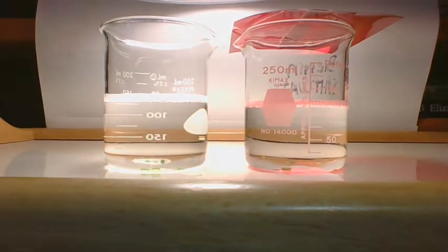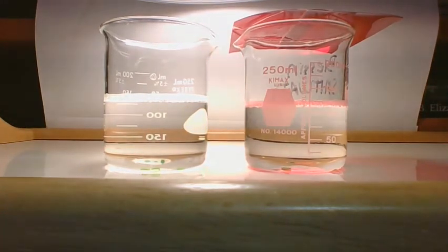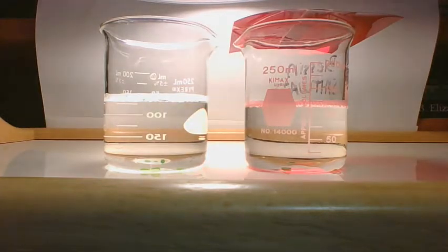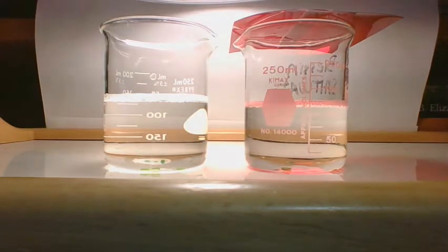Okay, at 2 minutes, we have 0 and 0 again. Okay, I'm not sure how much you can see, because when I'm looking at this, I can't see the camera because I'm behind it right now, and it's aimed forward, and I can sort of see it if I look to the side a little bit. Okay, so you should have 0 written down. That's all you should have written down right now.